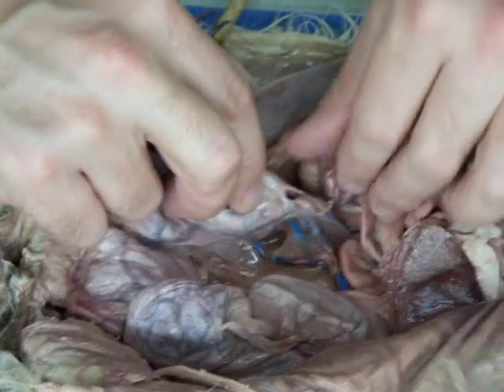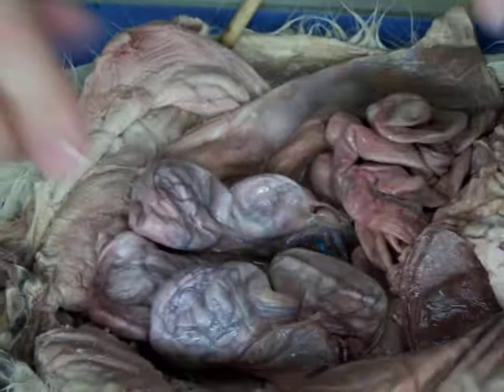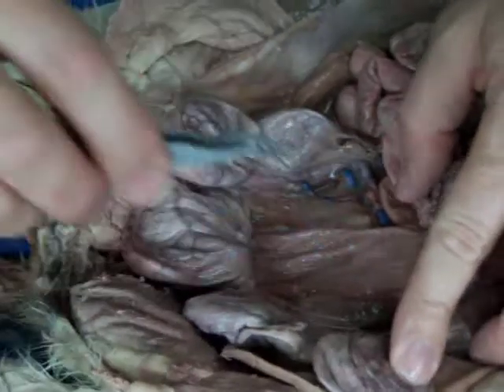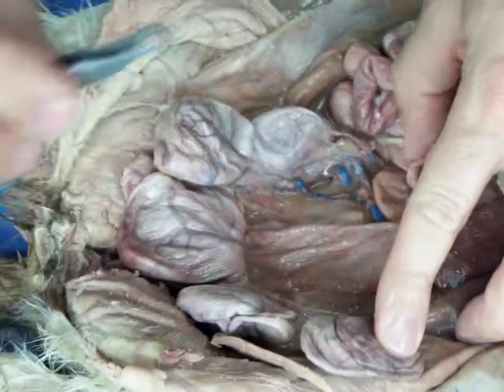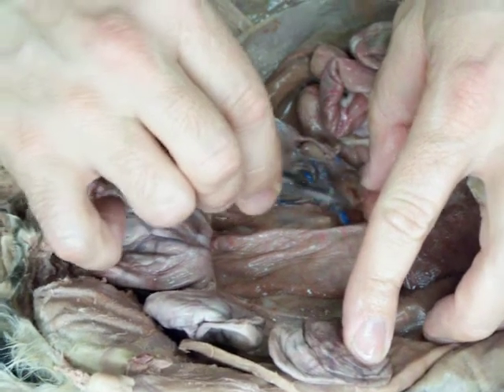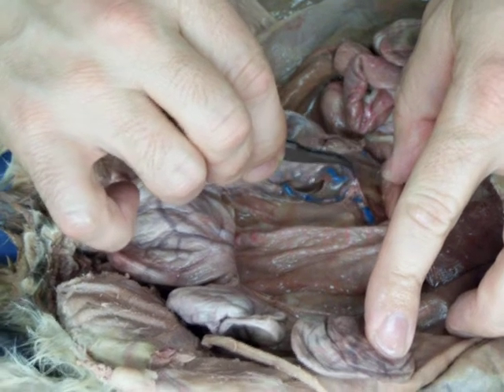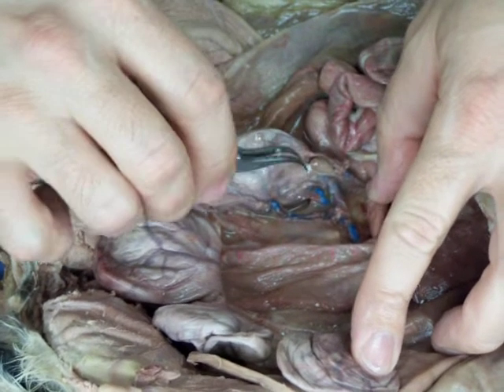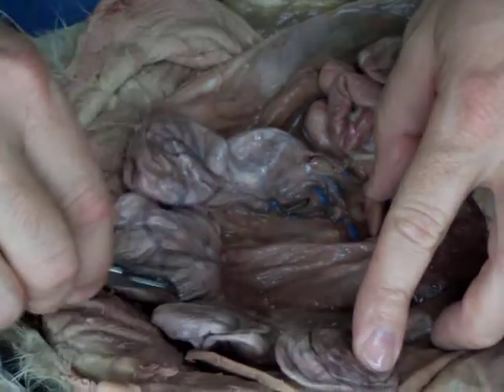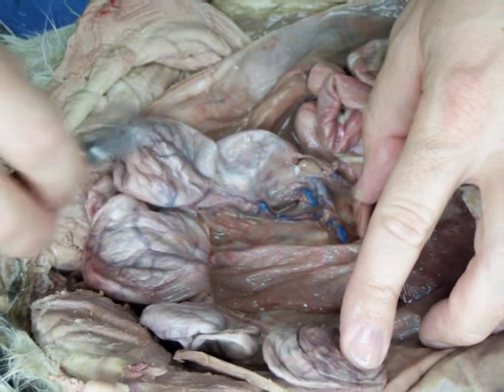Now here you can see, because it's pregnant and everything's enlarged, the vasculature is really clean also. And so the gonadal arteries and veins that they talk about generically are illustrated here. And these are the ovarian artery and vein. You can see those here running out to the ovary and the uterus. In the male, that would be the testicular artery and vein, and they go down to the inguinal canal to lead into the scrotum.